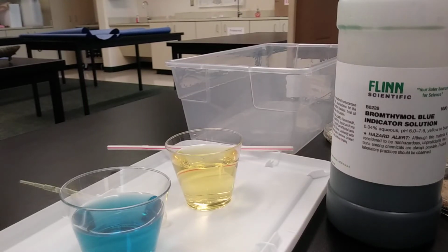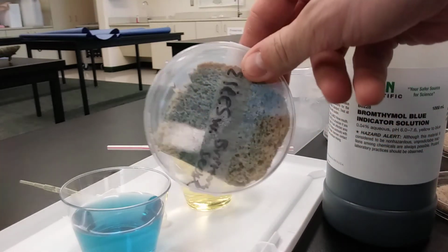All right, hi everybody. This is Mr. Nolan, and I just want to talk to you about what I'm going to set up here for our investigation with fungi. So what we're trying to do is figure out: are fungi really more like plants or more like animals?